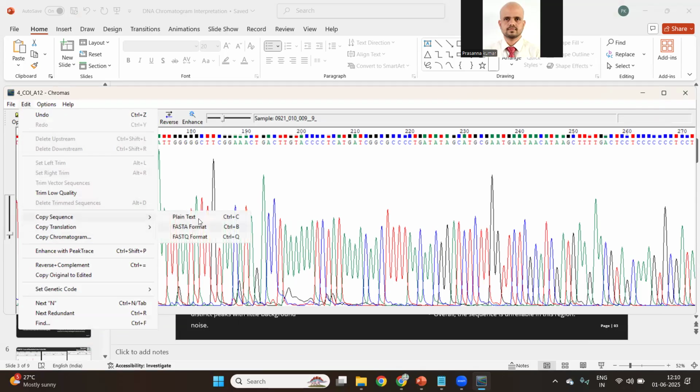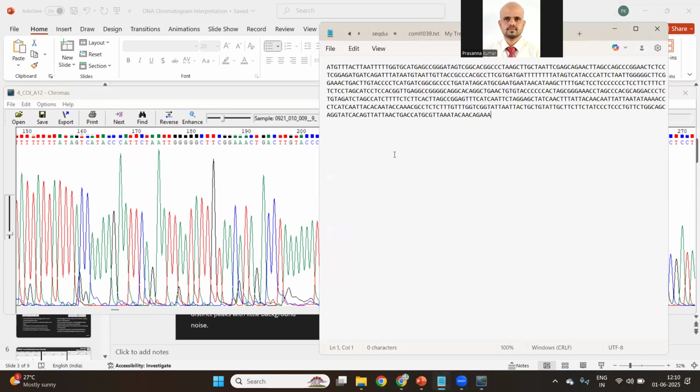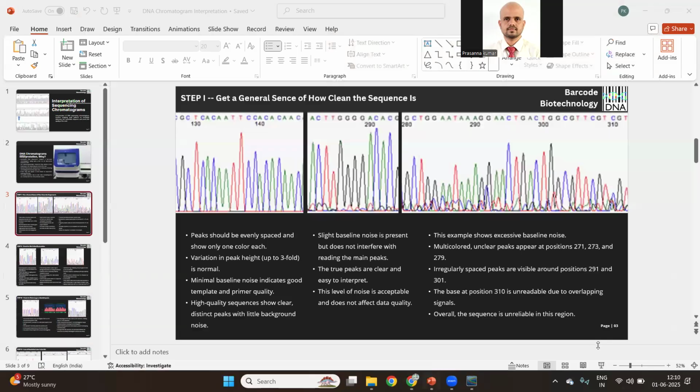So after you are done with the chromatogram editing, go to File, then copy sequence, FASTA format or plain text format. So Edit, second option, Edit, copy sequence, plain text. Open a notepad file, just Control V, paste it. You will export the sequence out of the chromatogram file. This is done after completing the editing of the chromatogram.